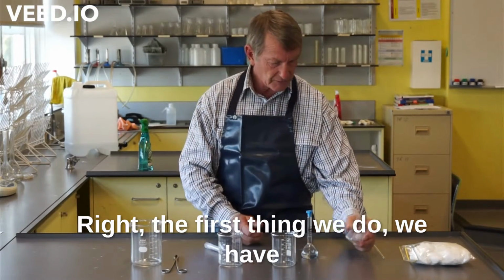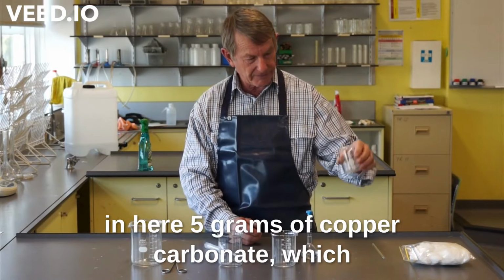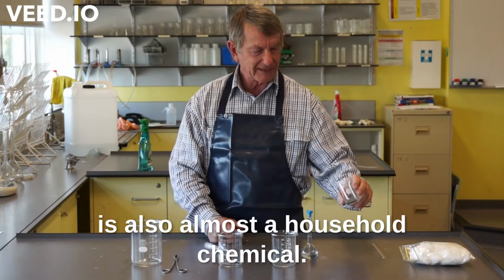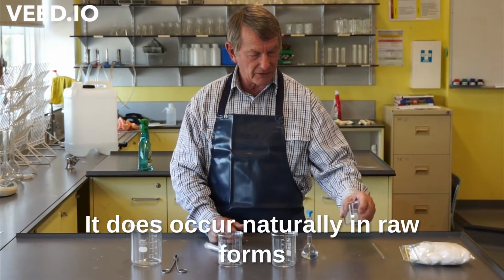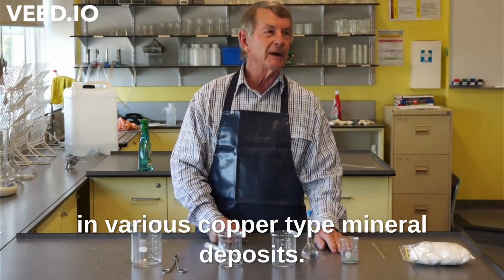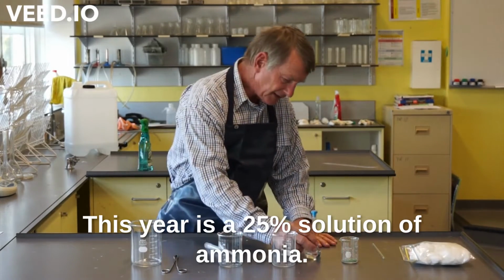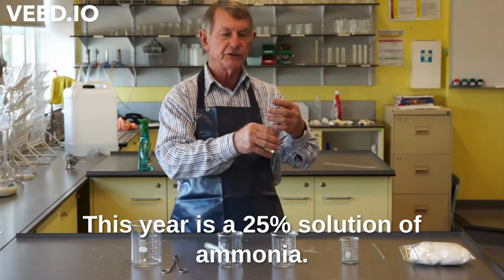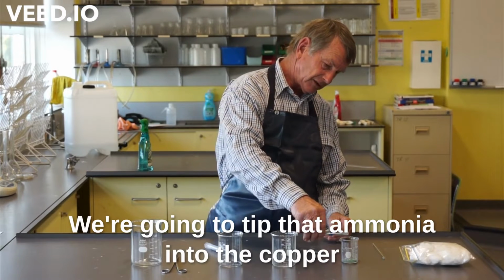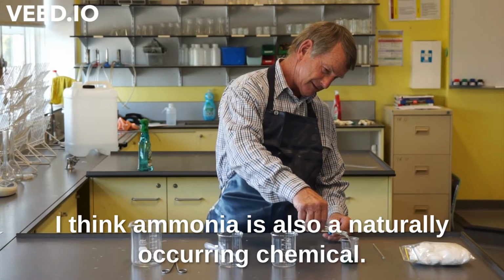The first thing we do, we have in here 5 grams of copper carbonate, which is also almost a household chemical. It does occur naturally in raw forms in various copper type mineral deposits. This here is a 25% solution of ammonia. We're going to tip that ammonia into the copper carbonate and it will turn a dark blue colour, I think.